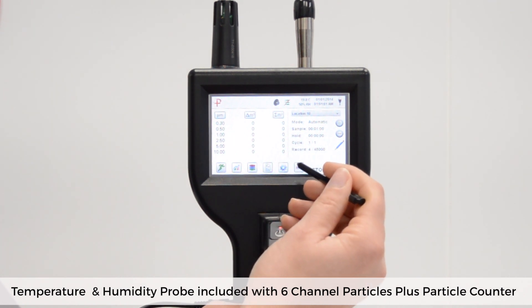Tap this again and you will see it changes to cubic meter. The ISO standard relates to a cubic meter and so this is the setting that we would use for ISO validation. It's quick to change and as cubic feet and meters are extrapolated from raw data using set conversion factors, this can be changed before, after or even during counts.